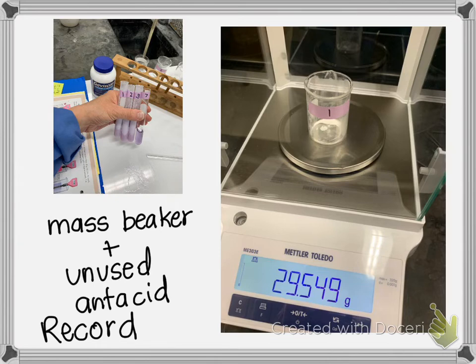Okay. So now you have collected all the data for that. Now it says calculate the mass of the antacid used to neutralize. So if you take the mass of the beaker with the antacid that you started with and subtract the mass of the beaker and what is left, then you will have the mass of the antacid that was used to neutralize the HCl. And on the last slide, I will write that down. I just don't have room here.